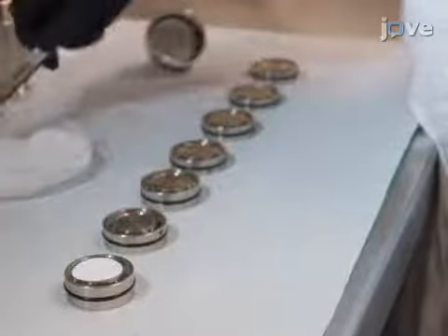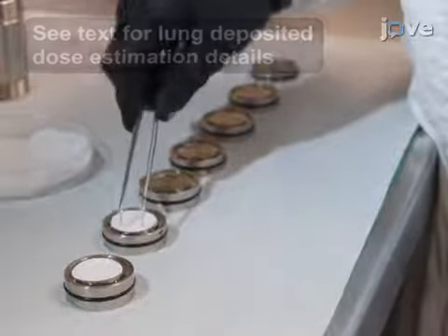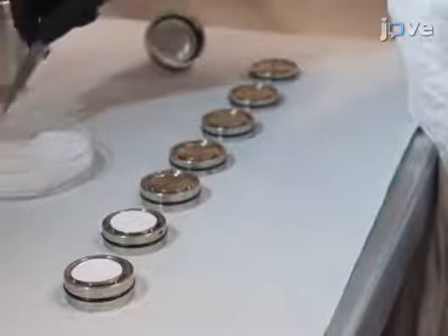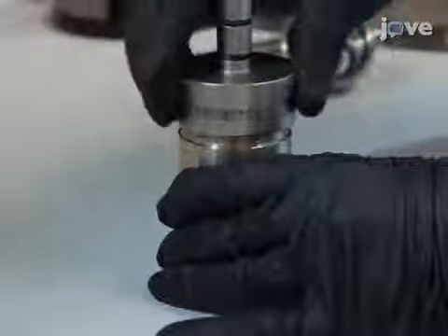Next, assemble the cascade impactor to collect the aerosol by placing pre-weighed filters onto each of the 7 stages of the cascade impactor and assemble the Mercer cascade impactor. Proper assembly of the cascade impactor is critical. The stages must be loaded in the correct order and orientation, with the largest stage closest to the inlet.